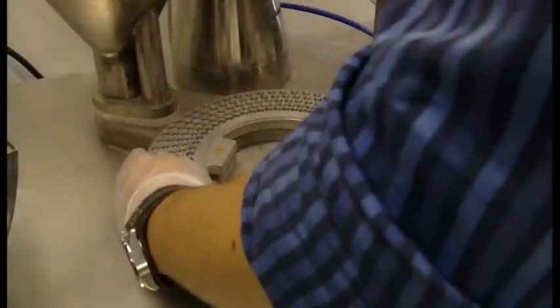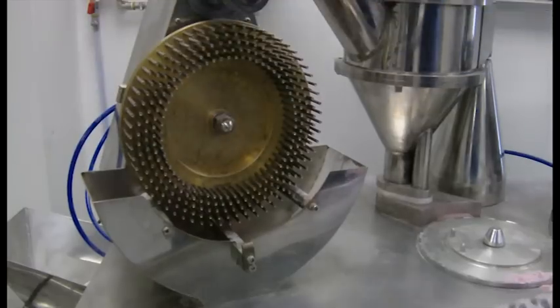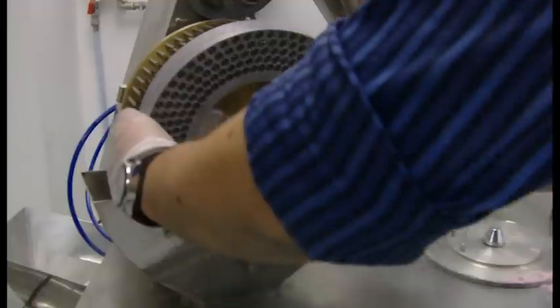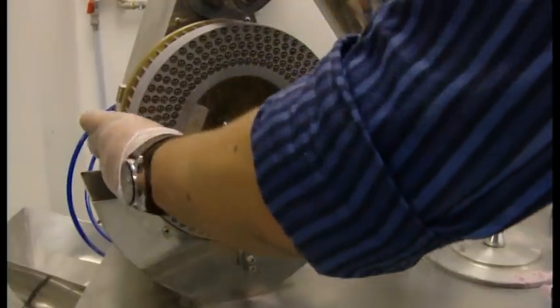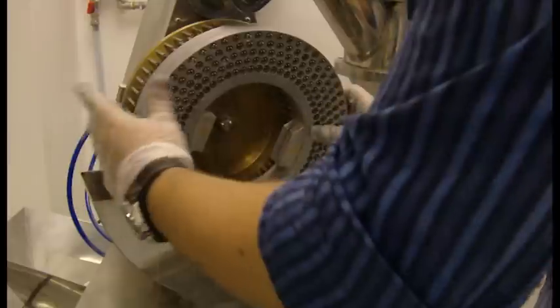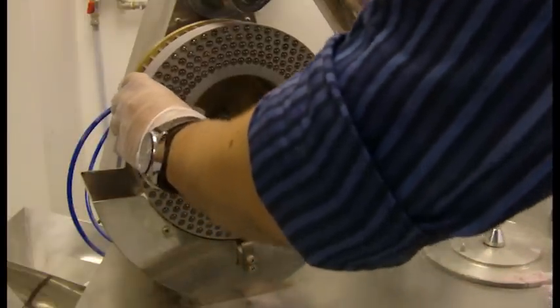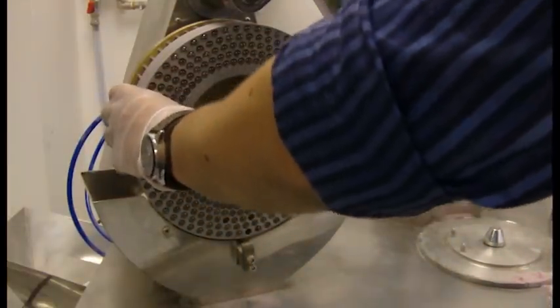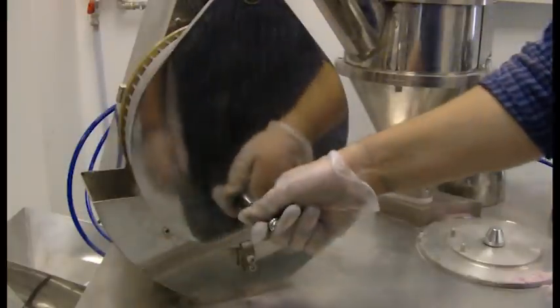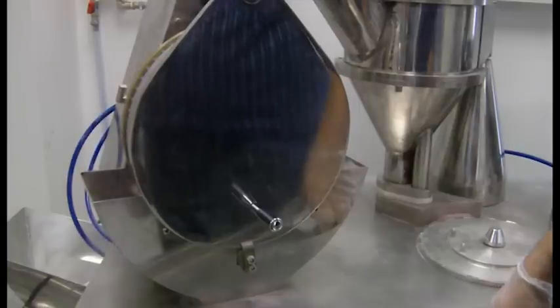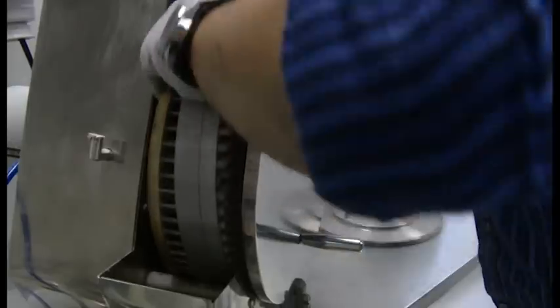The two plates are then placed back together and placed into the sealing section of the machine. Once they are aligned, the operator closes the guard and uses air pressure to seal the capsules. The capsules are then released from the plate.